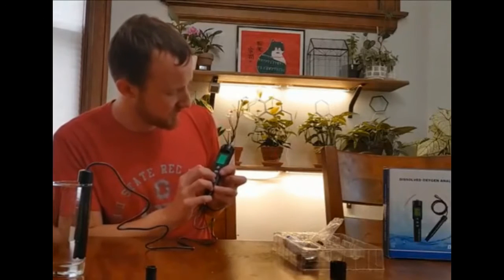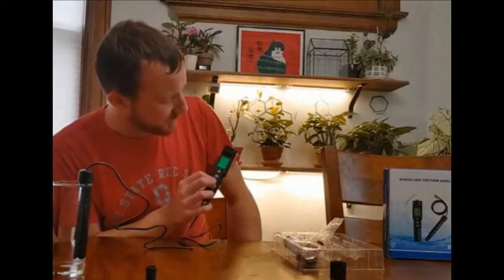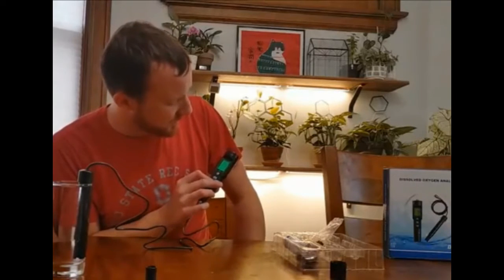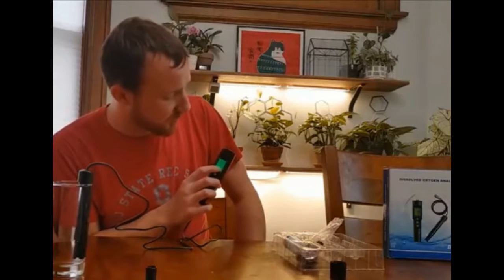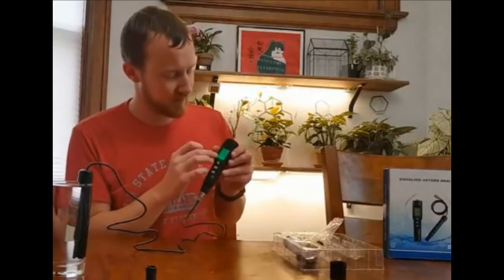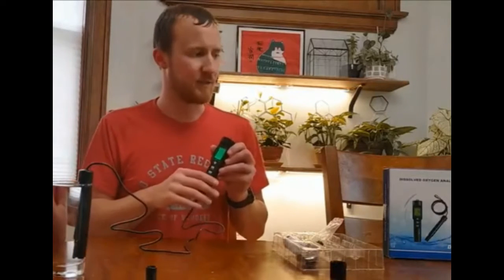I can change modes here, so it's 84.5%, 8.0 milligrams per liter, 84.4% - it hasn't stabilized yet. It's been sitting for a couple minutes. It does take some time, and that will tell you the amount of oxygen in this liquid.